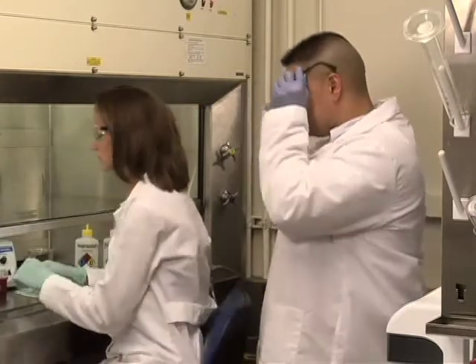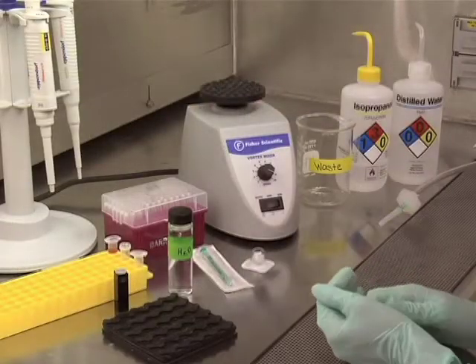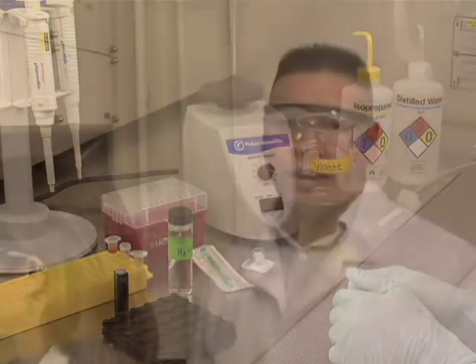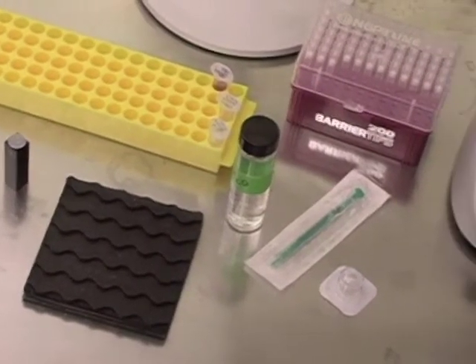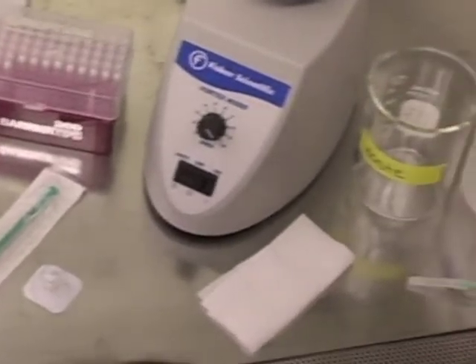Be sure to wear personal protective equipment, lab coat, gloves, and goggles. Sample prep will be done in a hood to minimize dust contamination. Dust particles, on average, are greater than 1 micron or 1,000 nanometers in size. The intensity of light scattered is proportional to the diameter raised to the 6th power. Thus, larger particles will scatter more light and will interfere with your results.